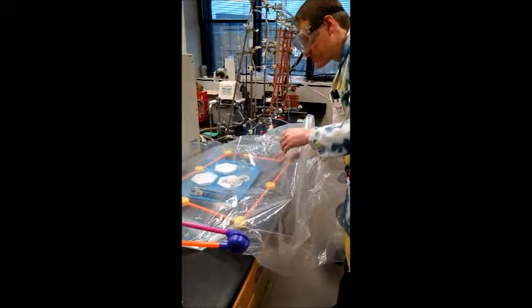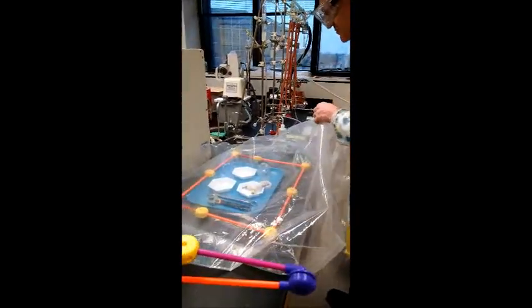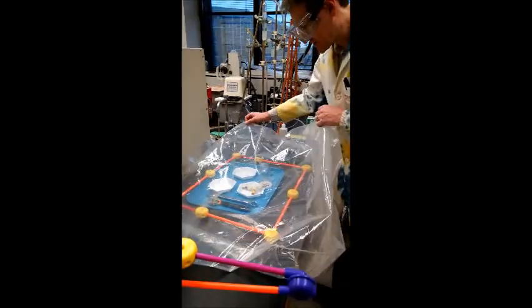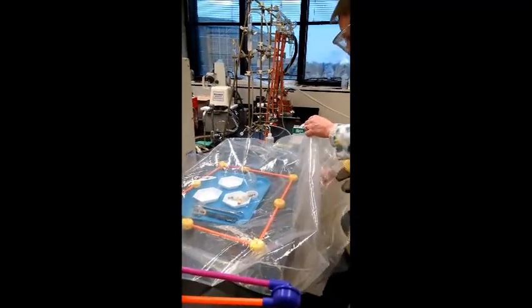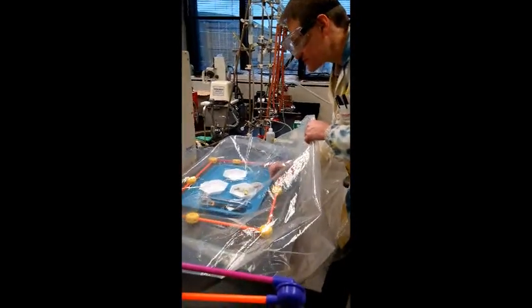Don't put paper products. Everything here is plastic, metal, glass. Don't put paper products in here because paper absorbs water and then that can contaminate the atmosphere.